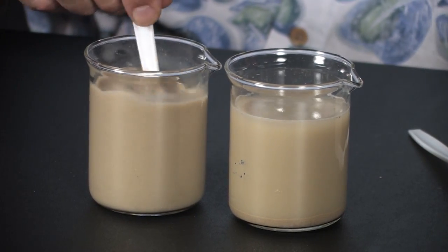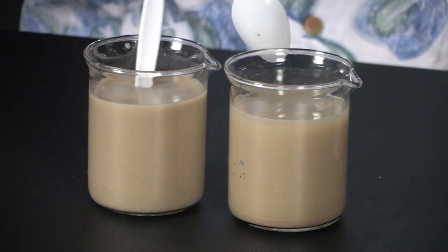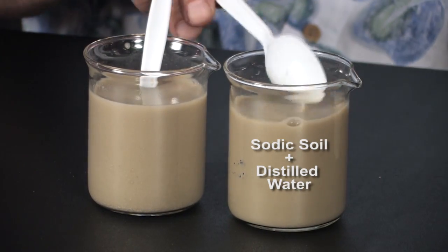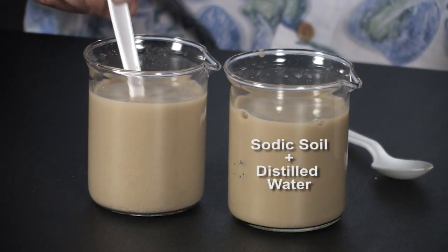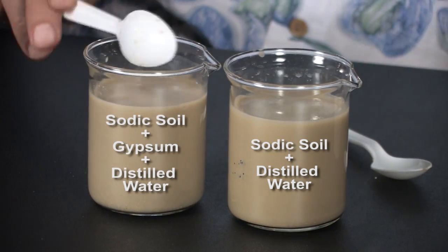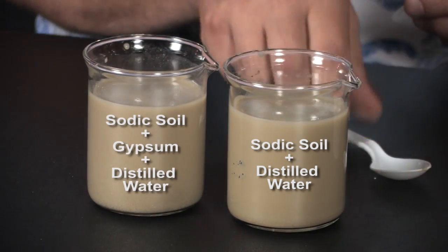What we should see is that this one that just has soil will stay suspended, while this one, which has soil and gypsum, is going to start to settle out.